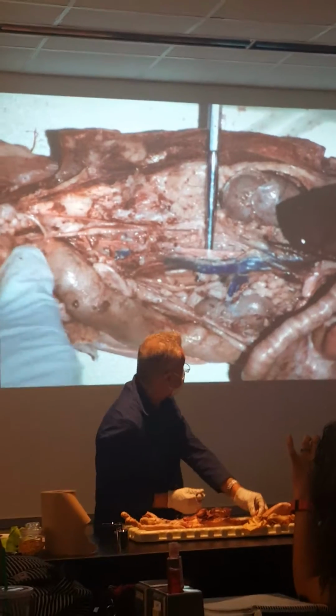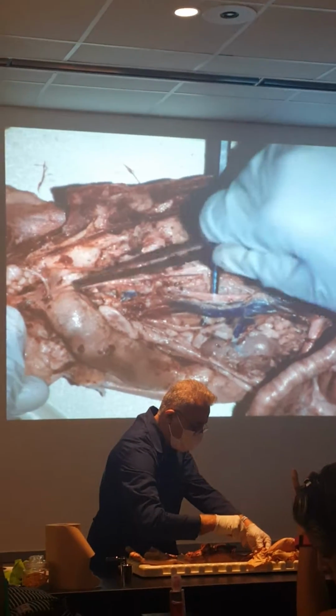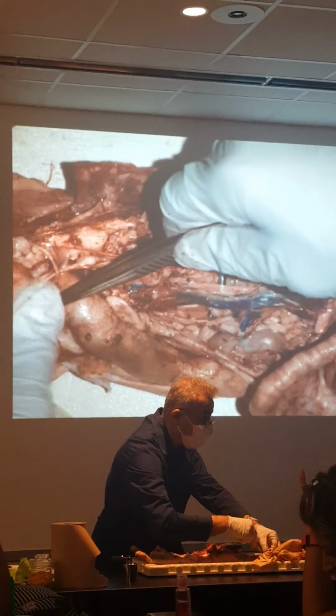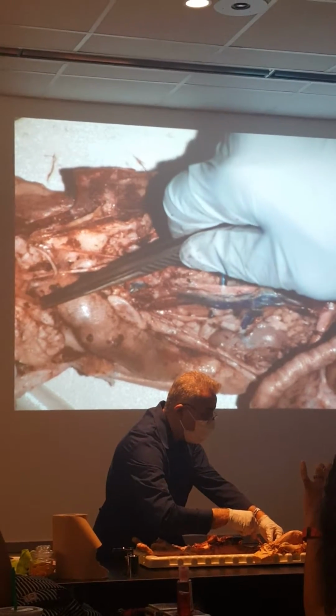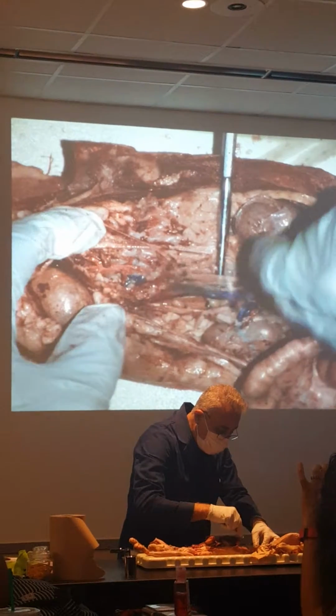All right, so they keep going downwards, and they hit different organs, one of which hits the bladder. Bladder artery. There's one on each side. See that? This is the bladder, right? One on each side. Okay. Going down a little bit more.